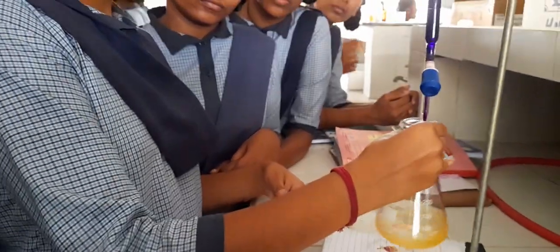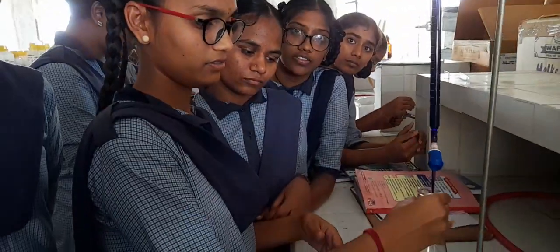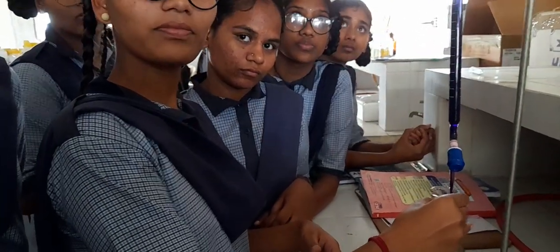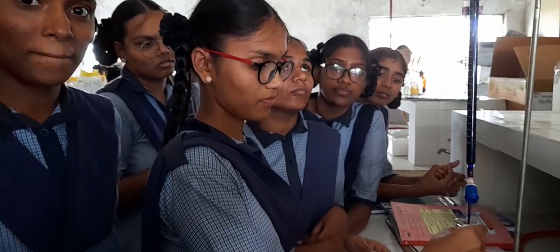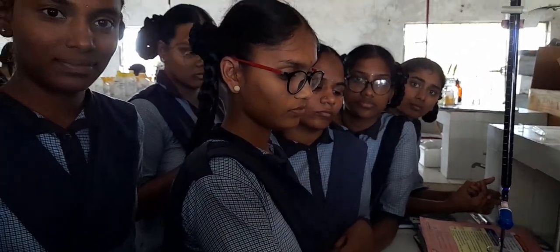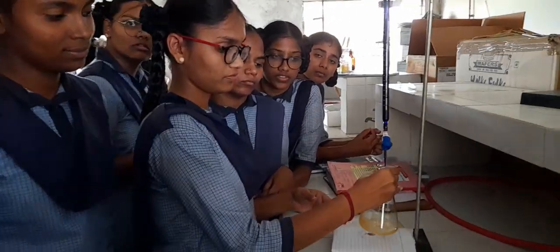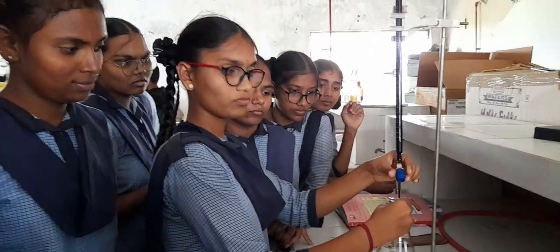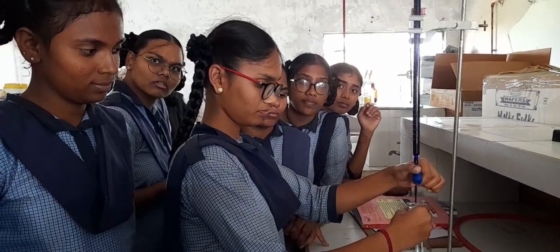Already you might have done one reading, right? Yes, ma'am. We got 21.5. Okay. So the first reading is okay. But as soon as you are coming across 18 or 19, you have to be very cautious because a single drop is going to give you the end point. So certainly you might have crossed that point in the first reading. Now be cautious. Make sure that you get the exact point. After this one, take one more consecutive reading so that we can move on to our calculation part. Okay. Good job.